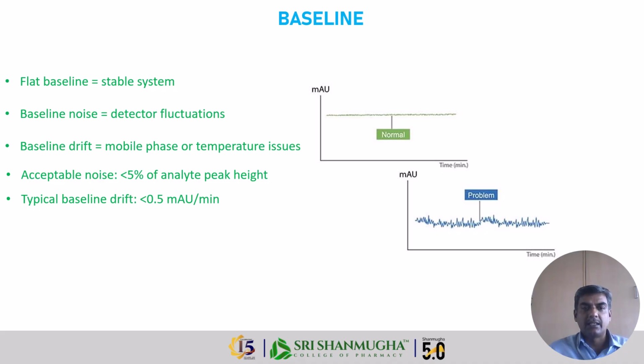So what do you mean by baseline? Baseline is the signal trace along the column as our mobile phase moves through. It should be very stable and straight so that we can consider it normal. If there are any deviations or fluctuations in the signal, then the noise will be higher, so we will get problems during the collection of data from the chromatogram. A noisy baseline will hide the small peaks and ruin the sensitivity. So we should not get a noisy baseline. We should have a normal baseline.